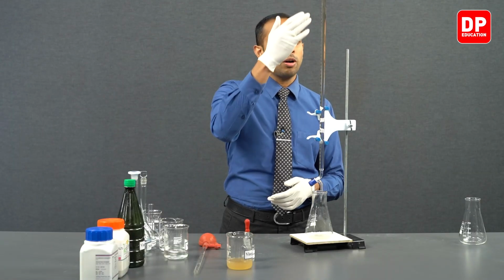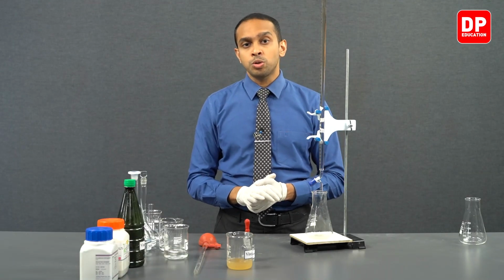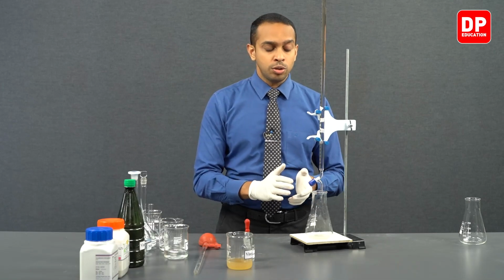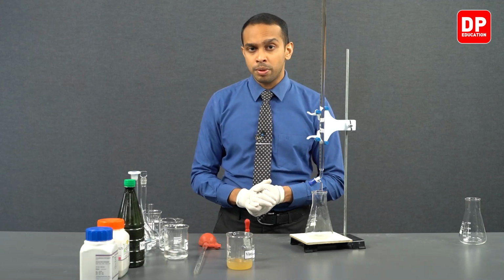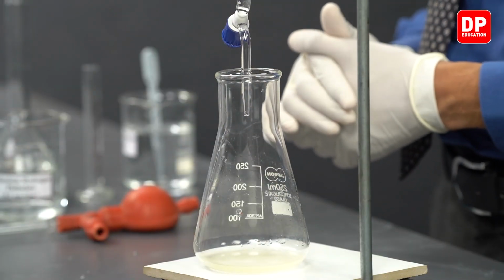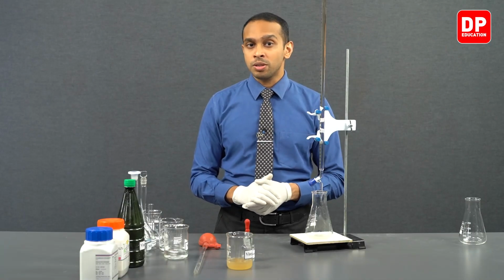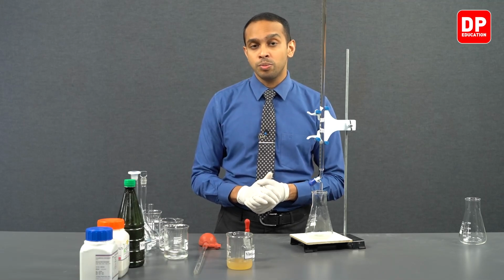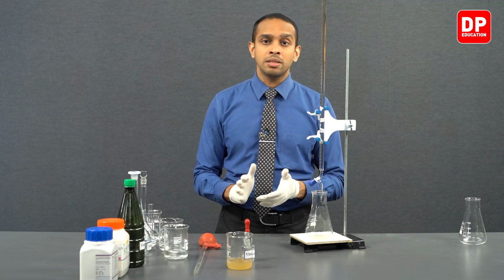So, we have the option of adding close to 20 cubic centimeters of sodium hydroxide somewhat fast into our titration flask. But we have to keep in mind, as we add the sodium hydroxide to our vinegar solution, you have to be very careful, because if you do not stir the solution, you might be misled to believe that you have already obtained an endpoint, because as sodium hydroxide enters the solution it will slightly turn to a pink color, but when you mix it, this pink color will disappear.